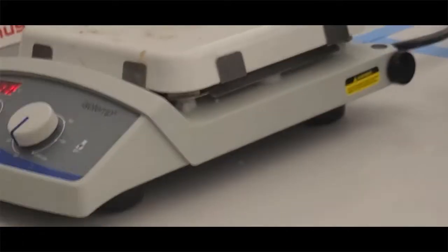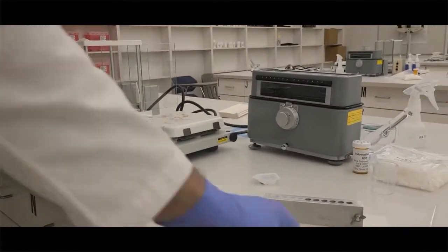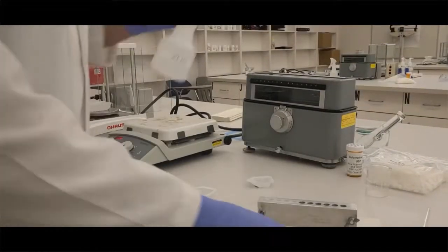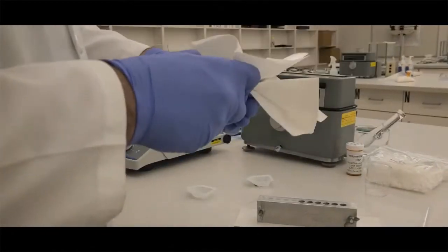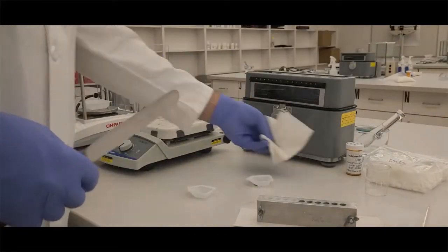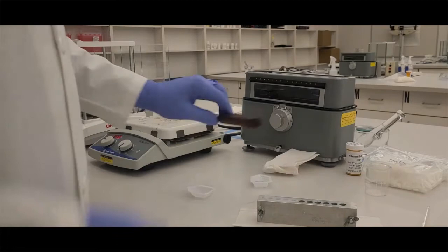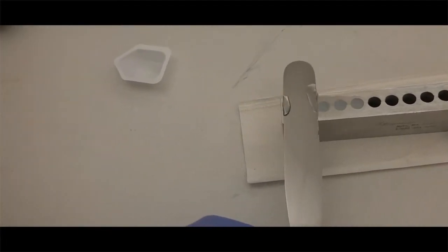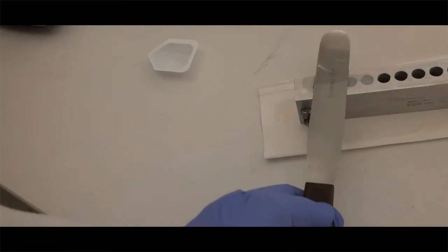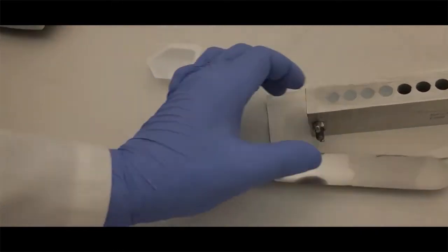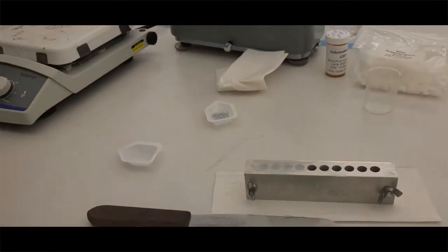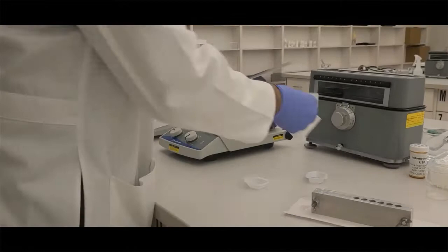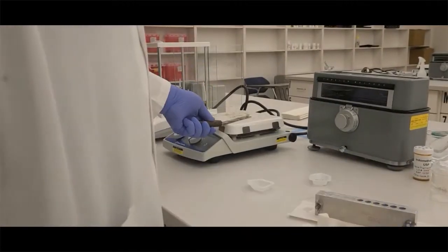I'm going to look back at my suppositories. They are completely solidified, so now I need to trim them. I'm going to get a metal spatula and clean it very well. I'm going to carefully put it on the hot plate for a few seconds—about three to five seconds on both sides. You're going to use that like a hot spatula. We are not scraping the top of the suppository—we are melting the top down. You're not going to scrape it because that'll lift them out. You just want to melt it like it's butter.